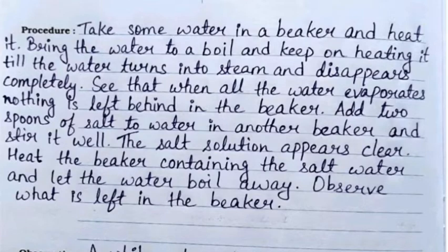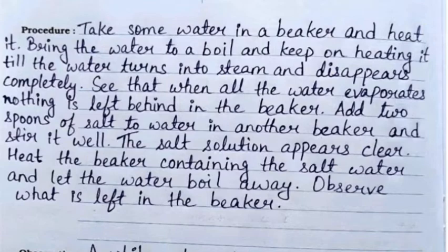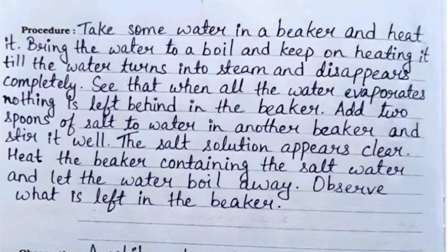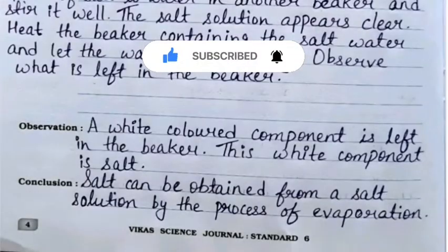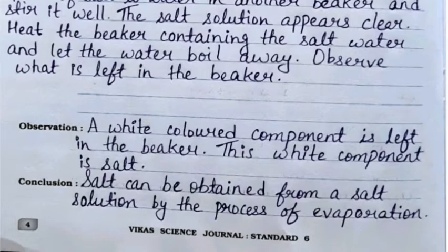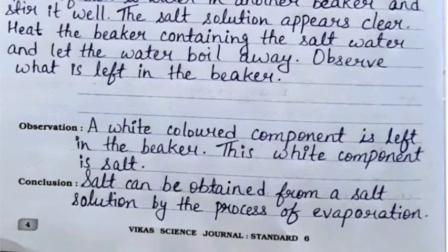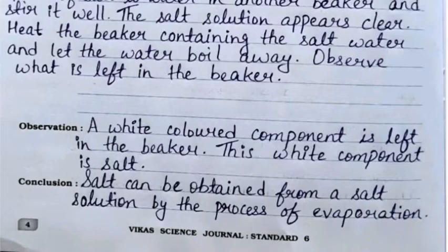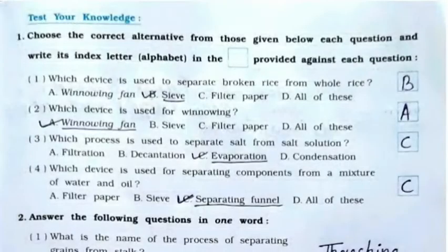Add two spoons of salt to water in another beaker and stir it well — the salt solution appears clear. Heat the beaker containing the salt water and let the water boil away. Observe what is left in the beaker. The observation is: a white color component is left in the beaker. This white component is salt. Conclusion: salt can be obtained from a salt solution by the process of evaporation.